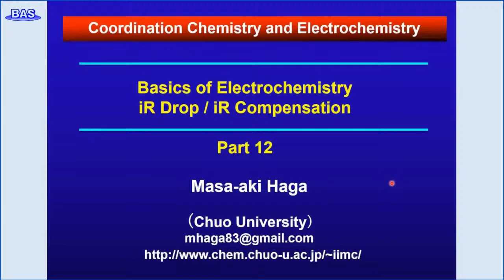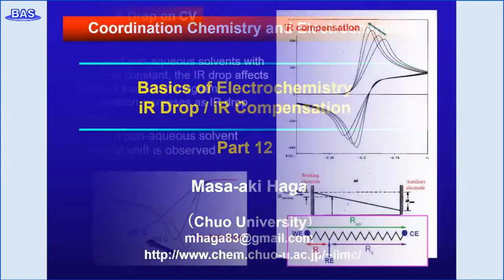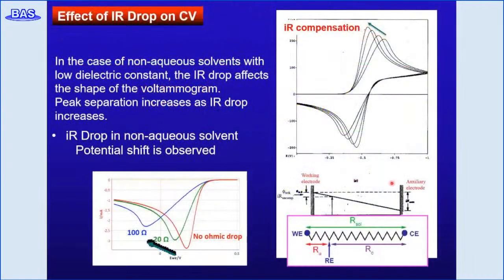Today I'll discuss the IR drop, which is often a basic problem for electrochemical measurements. Here is the CV measured in non-aqueous solvent. Since organic solvents have a low dielectric constant, their conductivity is low, and therefore the CV peak separation is generally larger than the theoretical value. This large peak separation arises from IR drop.